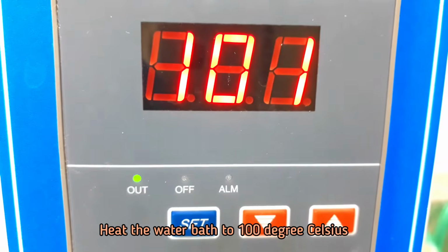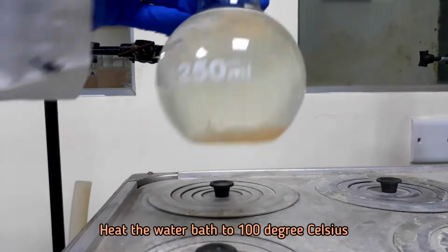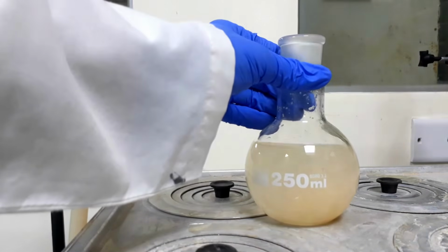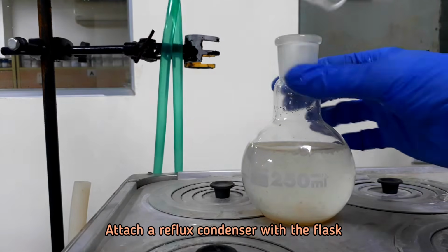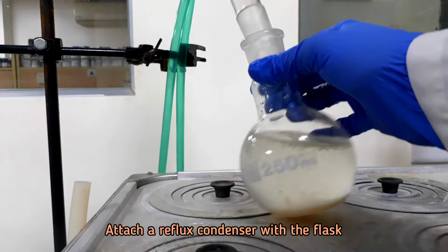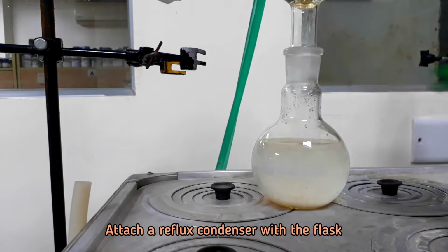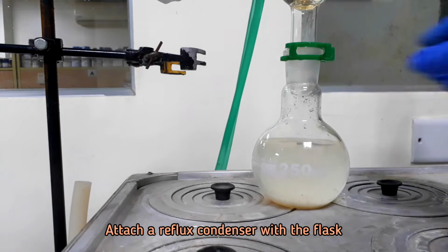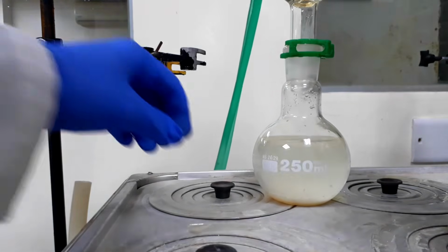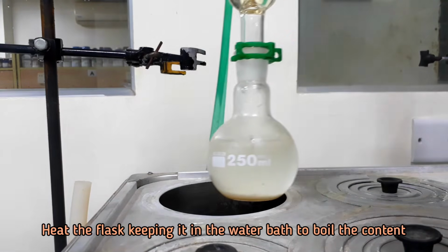Heat the water bath to 100 degrees Celsius. Attach a reflux condenser with the flask. Heat the flask, keeping it in the water bath, to boil the content.